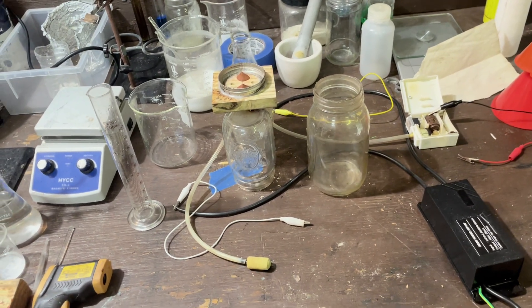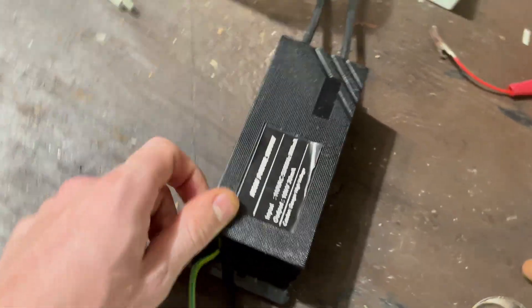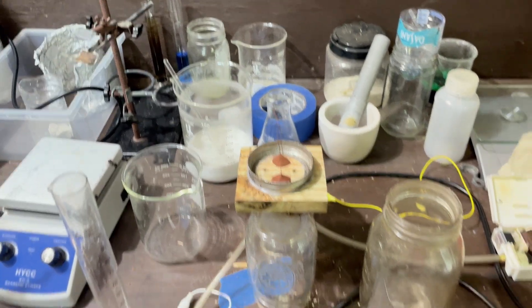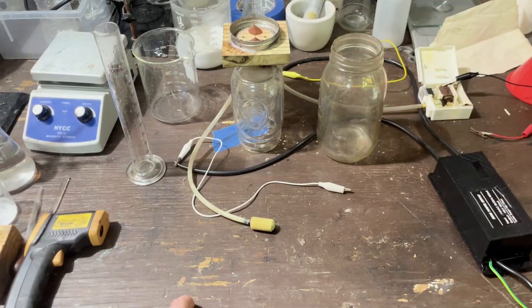It's not a lot, definitely not a lot, but if I can get a high voltage arc with this neon power supply right here, I can use that — just straight power — and I can make nitric acid out of air. That's kind of awesome.